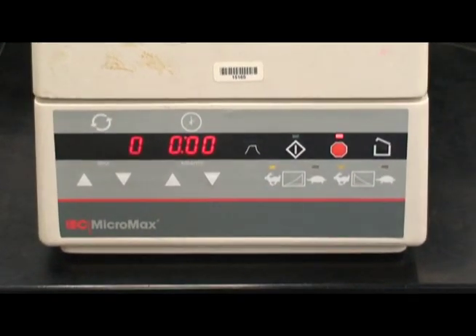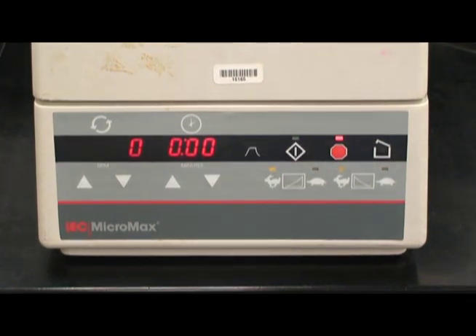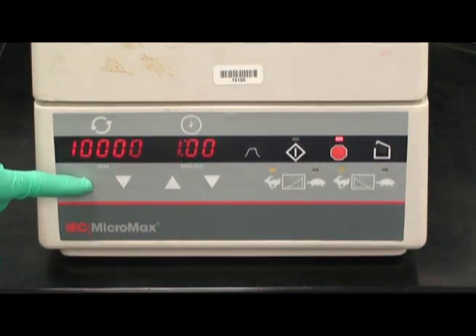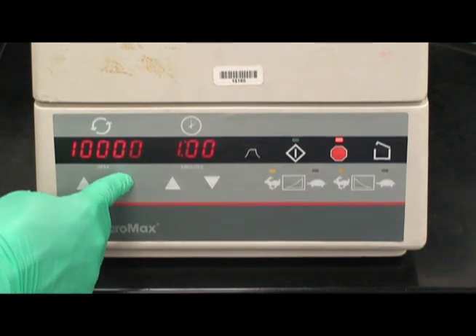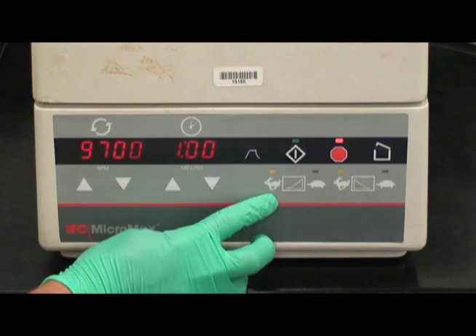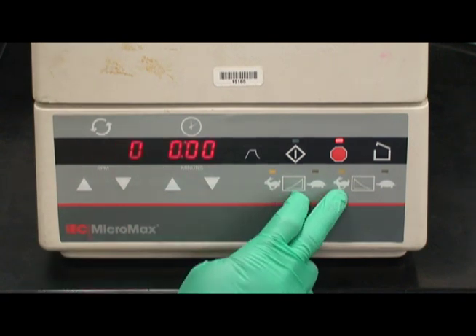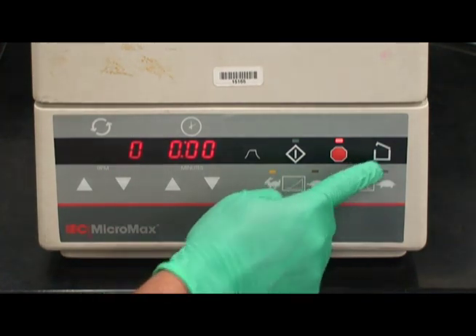This is another microfuge device. As you can see, the speed in RPMs and time in minutes can be adjusted by the arrows. The rabbit and turtle icons signify how fast the rotor will accelerate and decelerate. By selecting the rabbit for both, the rotor will accelerate and decelerate as fast as possible. This button opens the lid.